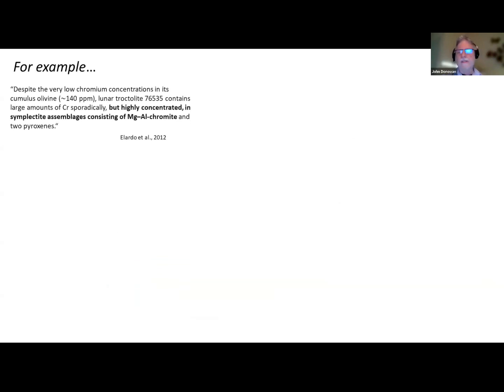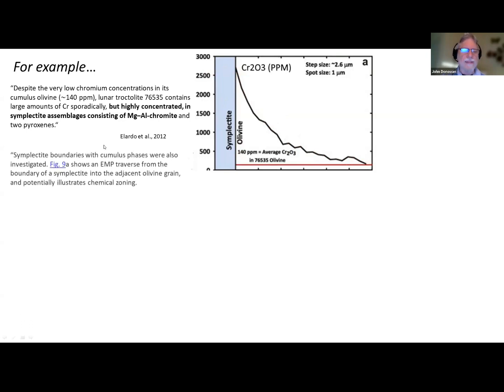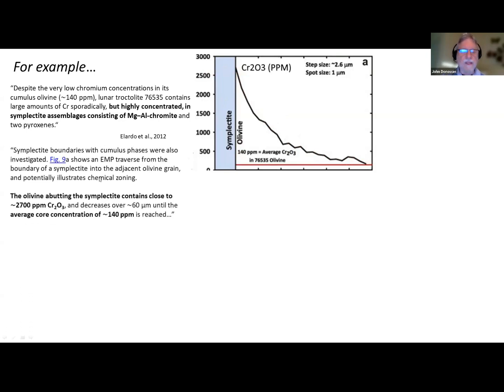So here's an example of a paper. This was a very unfortunate situation where a student of one of our colleagues was giving a presentation at a lunar planetary conference, and they were analyzing lunar olivines adjacent to some pyroxene and chromite materials. They're very complicated materials. They presented this data where they have an olivine phase and this symplectite complex. They were reporting 2,700 ppm of chromium oxide going down to some base level they assumed, and they said this potentially illustrates chemical zoning.